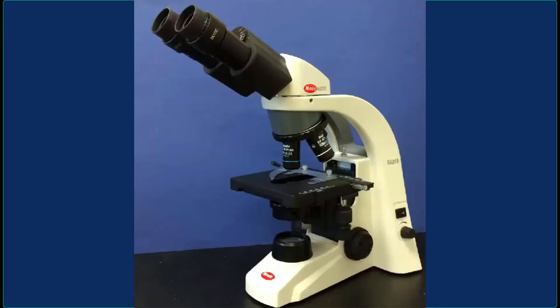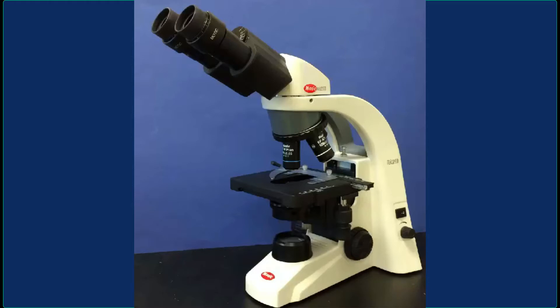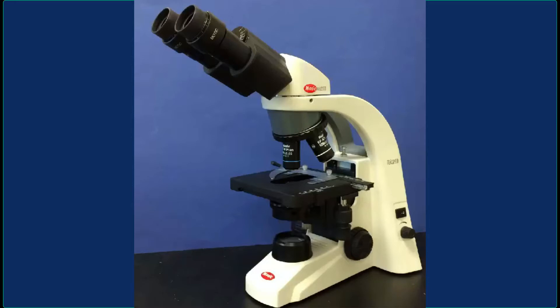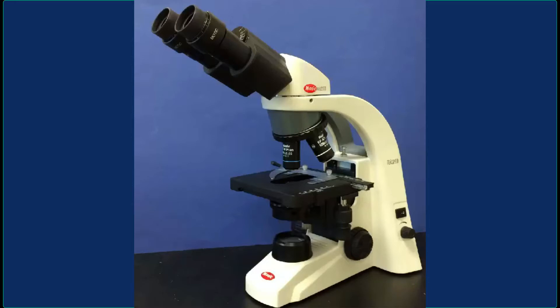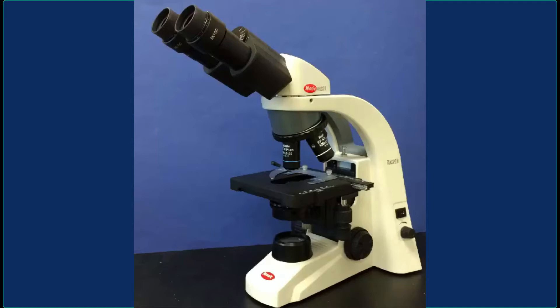Here is your microscope, and I'll go over the basic parts with you. As we go through these parts we'll zoom in and take a closer look at some of them. Then we'll discuss how you can switch the objectives to get different magnifications.